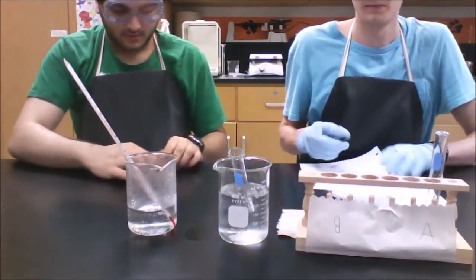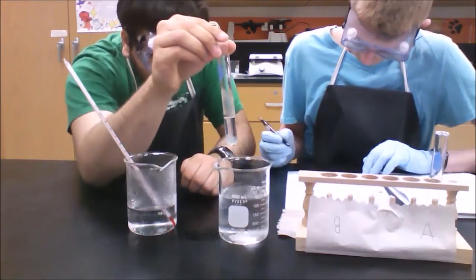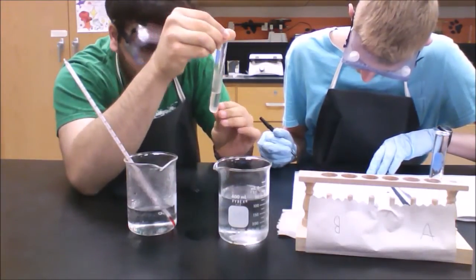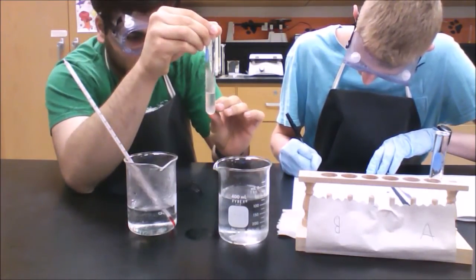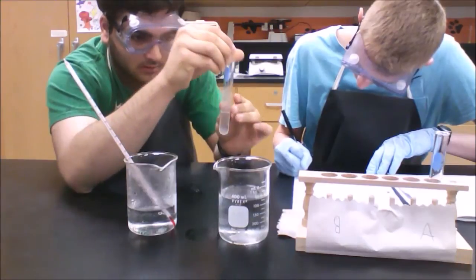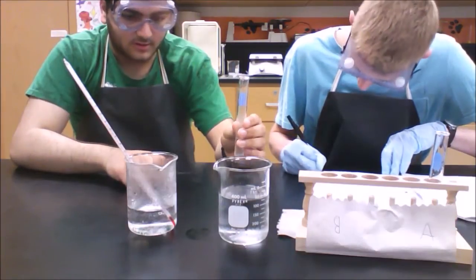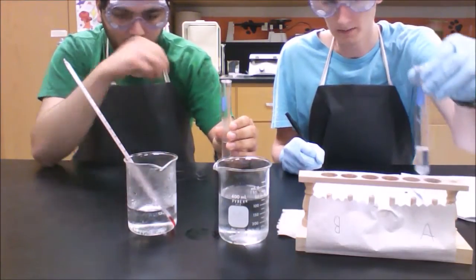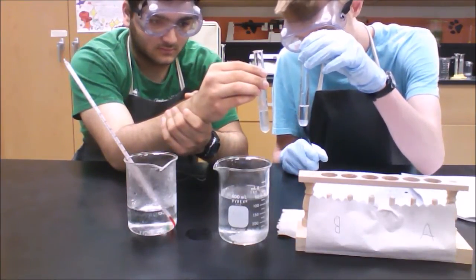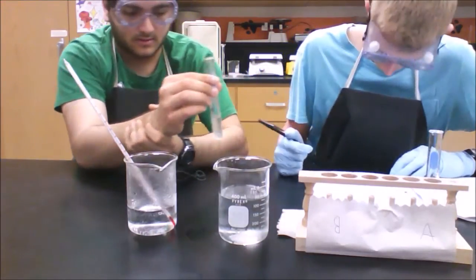After 3 to 5 minutes in the cold, test tube B of the complex ion solution, after putting it in the ice, has gone slightly darker on the bottom. If you can see, it's hazier and there's cloudiness and it's a little darker. Not dark in color, but slightly darker. So that's after 3 to 5 minutes in the ice. Now we're going to place test tube B in hot water. We need to compare it to test tube A, and as you can see here, it's much cloudier and much more dense than test tube A. So that's after cold.